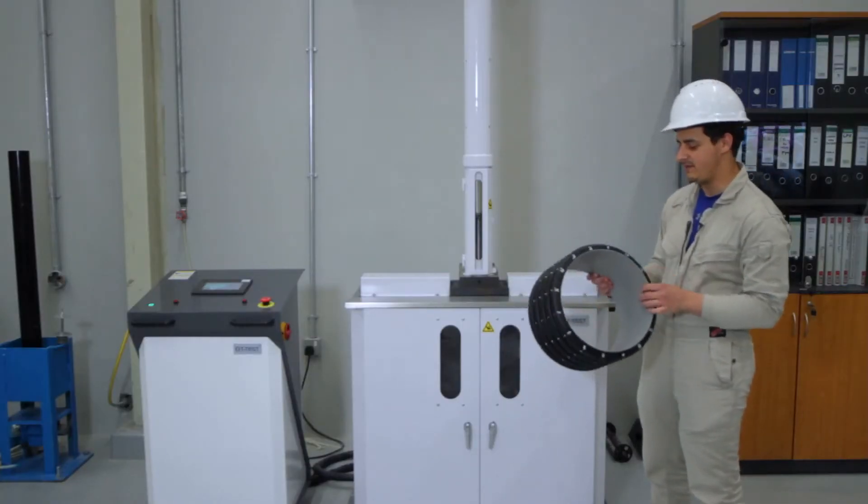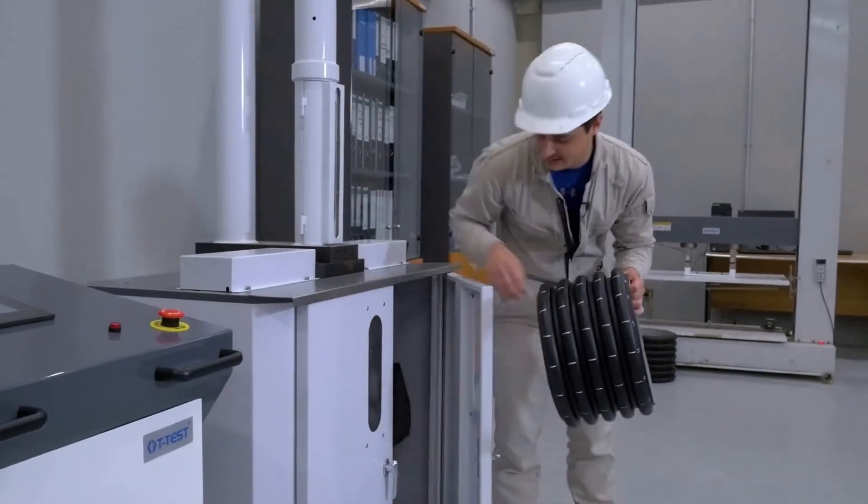Here's the sample that we have, and I'm going to load it into the impact testing machine.